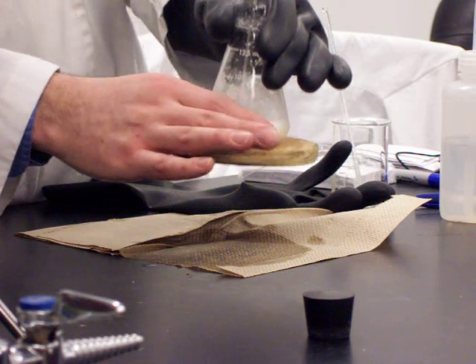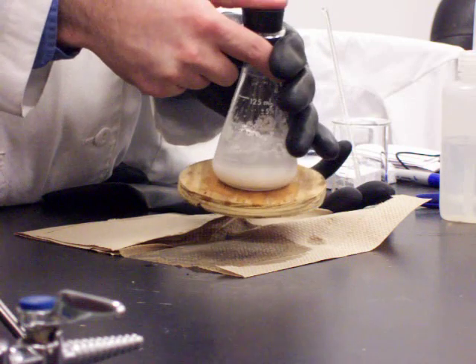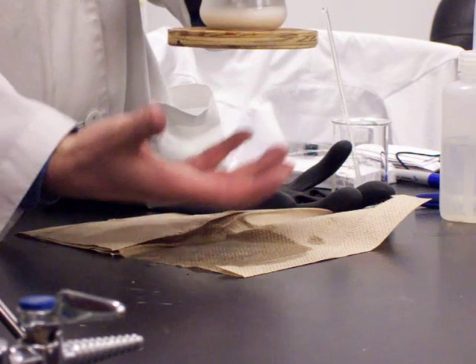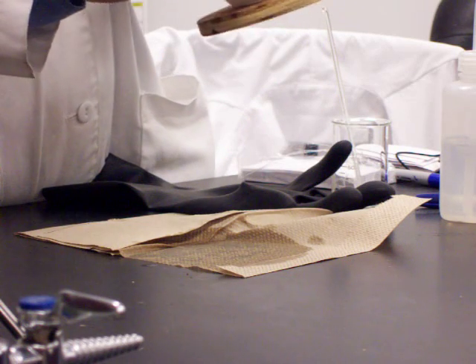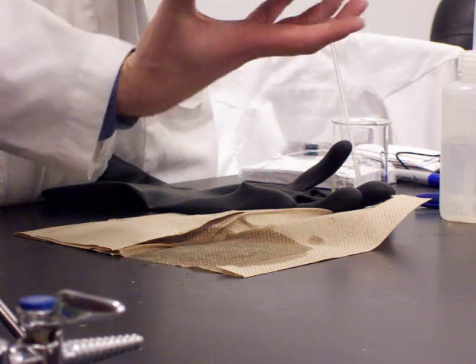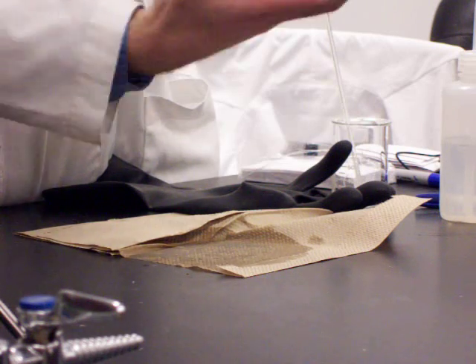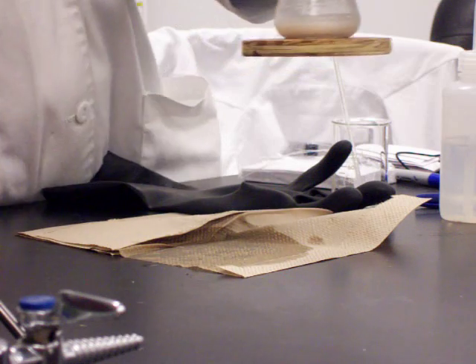What I'm going to do is put a cap on this because there are trace amounts of ammonia that you can smell, and ammonia smells not too pleasant. But I'm going to pass this around. Please just touch the flask — please don't pull on this. It is just a thin layer of ice and you can pull it off fairly easily. Please handle it gently and feel the outside of the beaker up in this area. Don't hold it down low — I'm afraid of you melting the ice or easily breaking it off. I will pass this around for you to smell. Please leave the stopper on the flask.